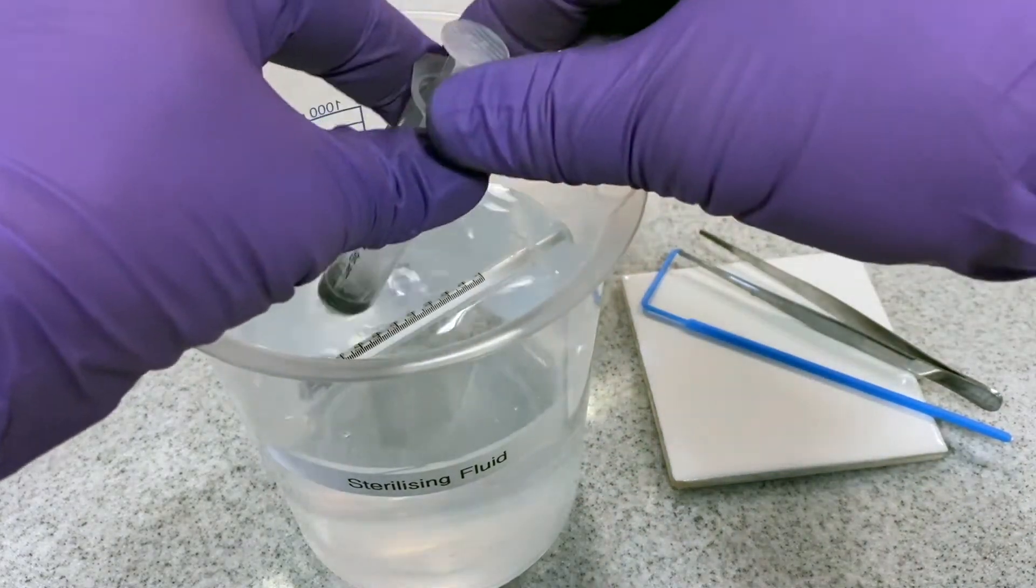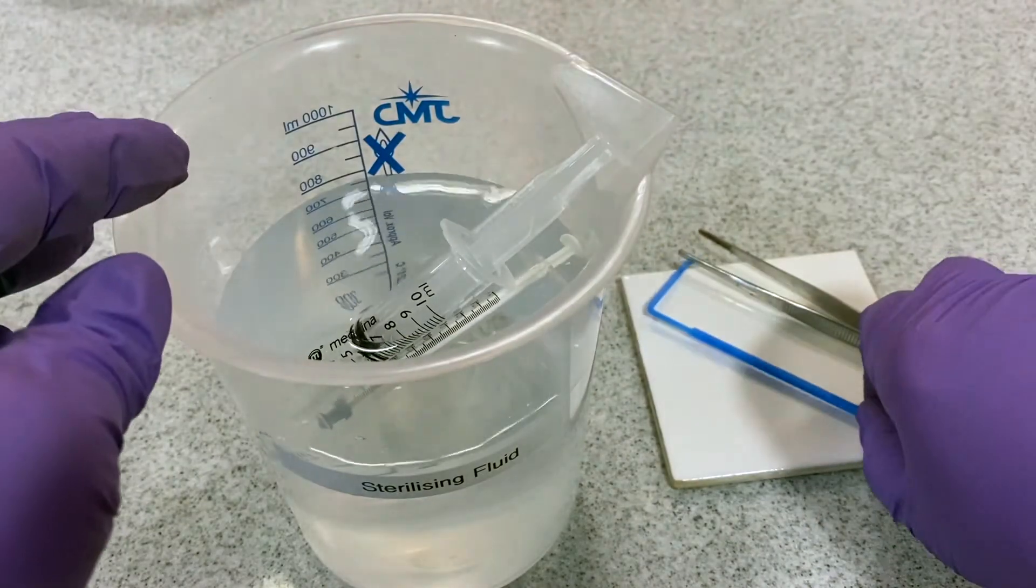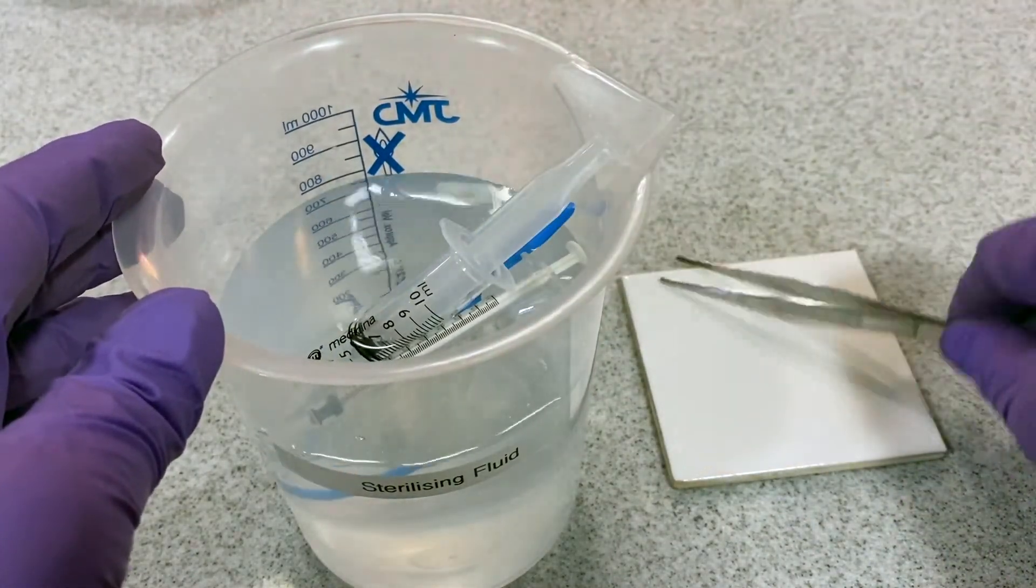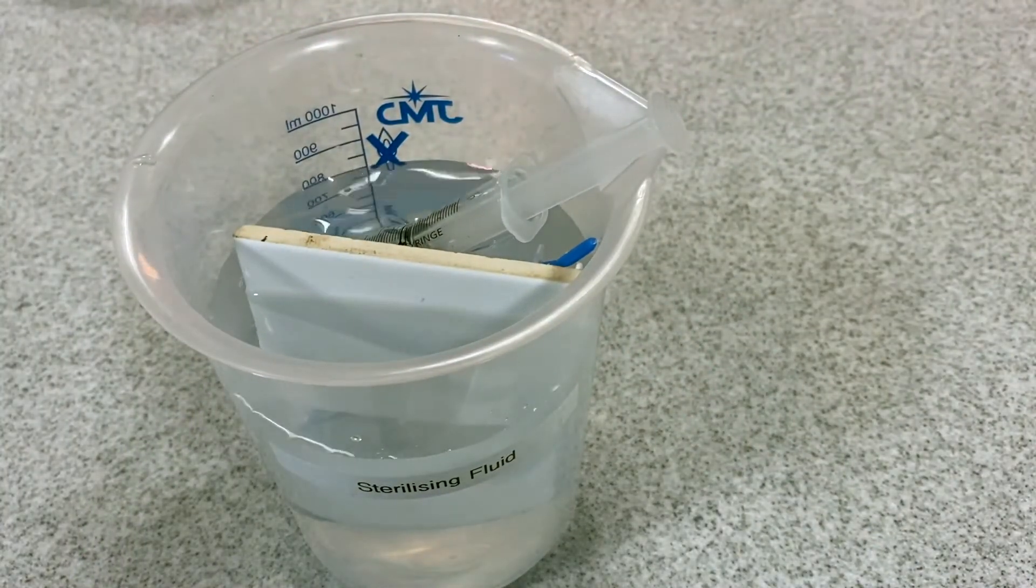As good scientists we should always work in a tidy fashion and to prevent cross-contamination, all the equipment used in contact with the bacteria is placed into a beaker of sterilizing fluid.